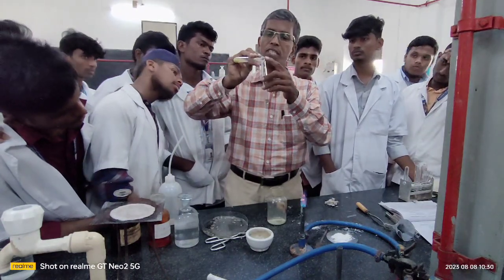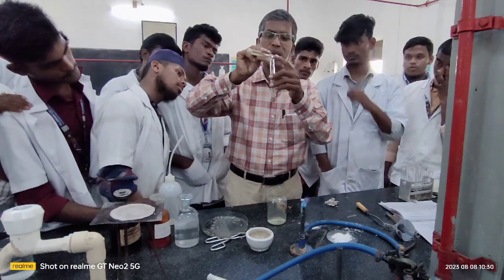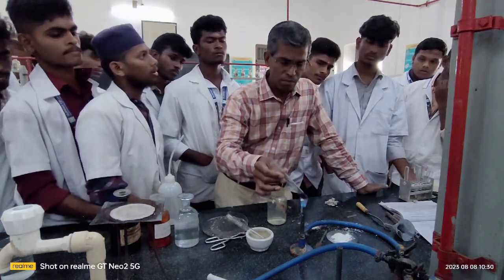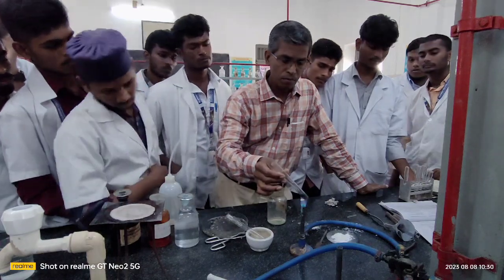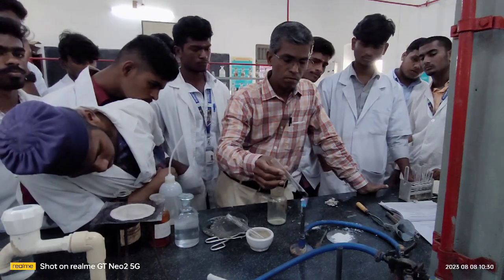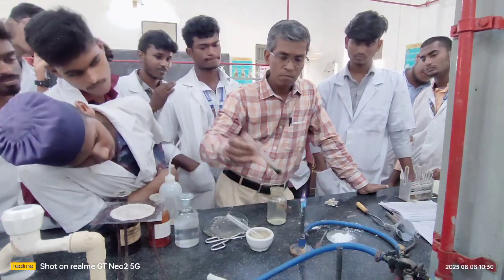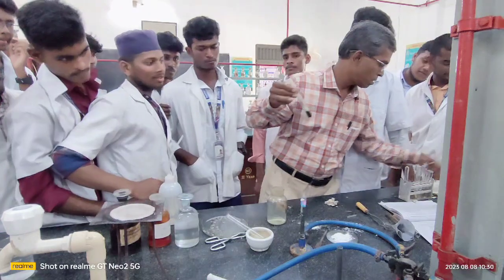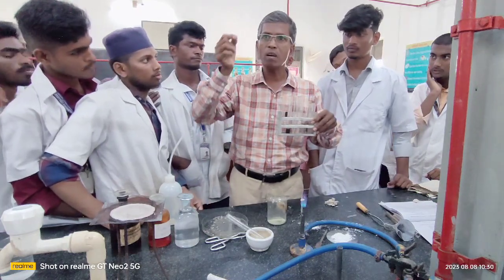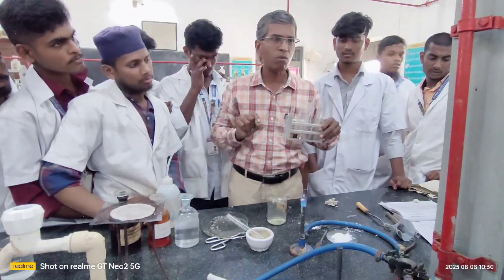Now you add a little of this freshly prepared ferrous sulfate into the test tube that contains sodium fusion extract. Yes. Now boil this and allow the matter to cool down first. Boil first. Allow it to settle down for some time, that is, allow it to cool down. Once the cooling is over, you add dilute sulfuric acid and see whether you get blue color or green color.